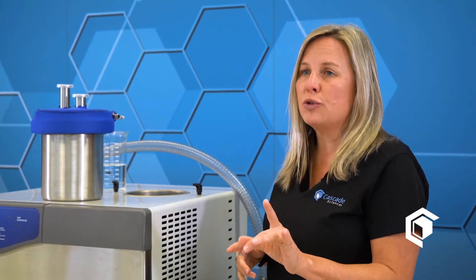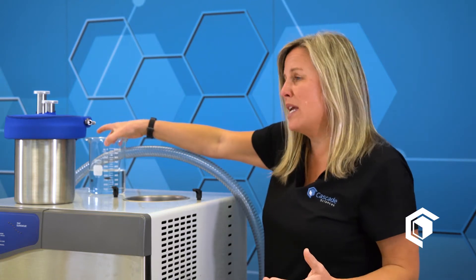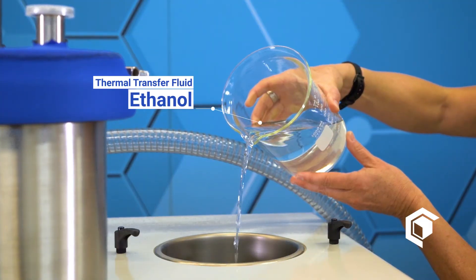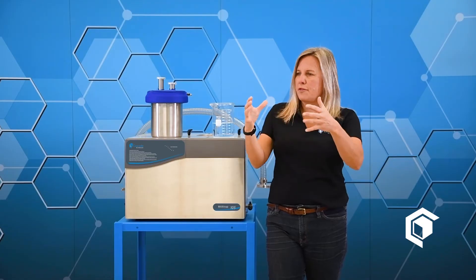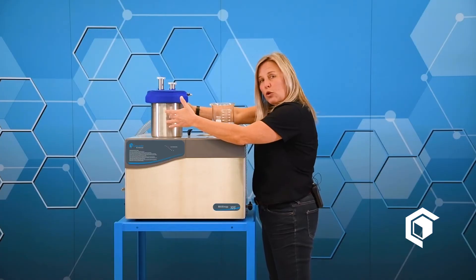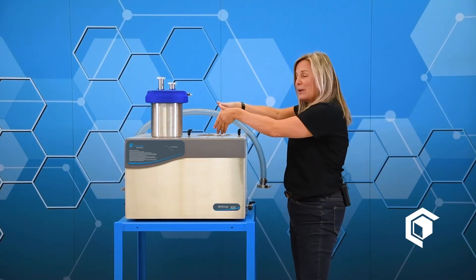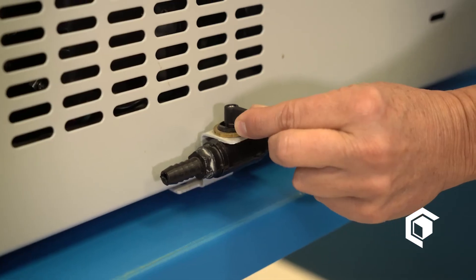There are a couple of key things you need to do when setting up your max trap for the first time. The very first thing is to add between 400 and 600 milliliters of a thermal transfer fluid into the stainless steel reservoir. This acts as a thermal transfer medium that gets coldness deep inside the cold well quickly and efficiently — that is a must do. When pouring your ethanol or thermal transfer fluid into the reservoir, make sure the side drain valve is closed. Don't make that mistake.